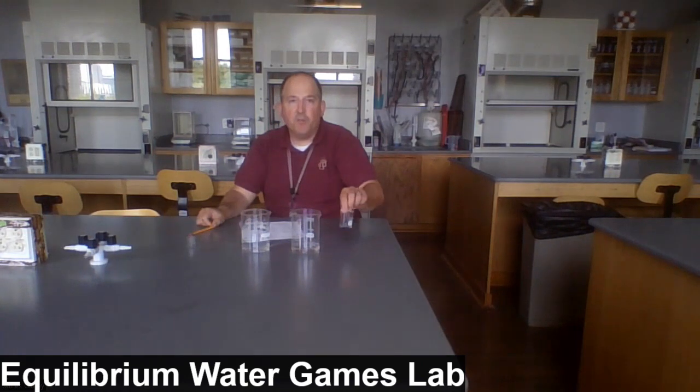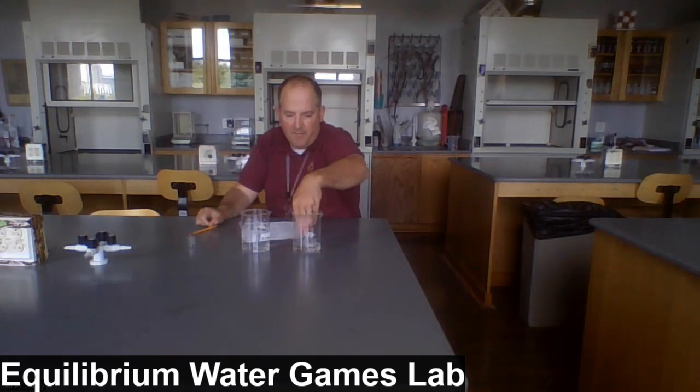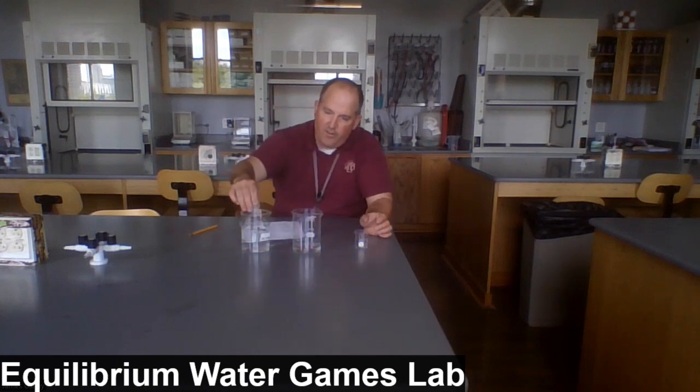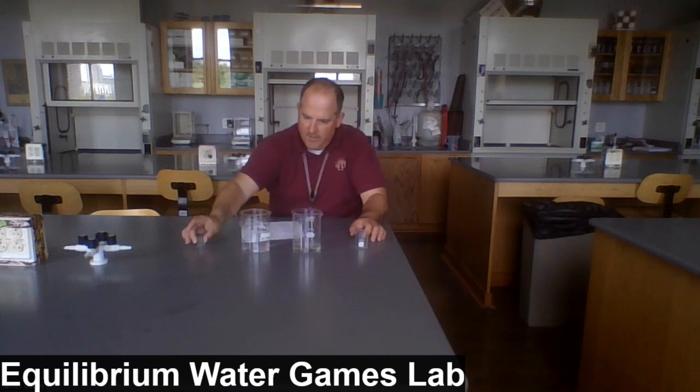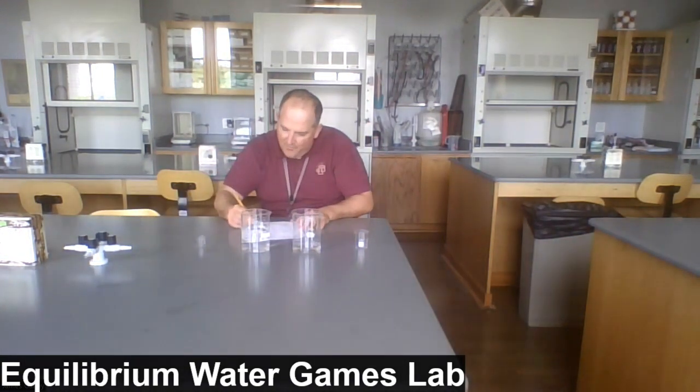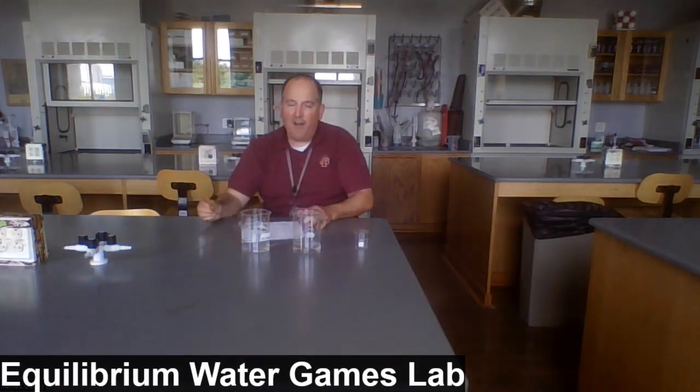We may have reached equilibrium here. Let's do it one more time to make sure. Getting as much water as I can from beaker A, transferring as much water as we can from beaker B. And again, 90 and 410. So we've now reached equilibrium.